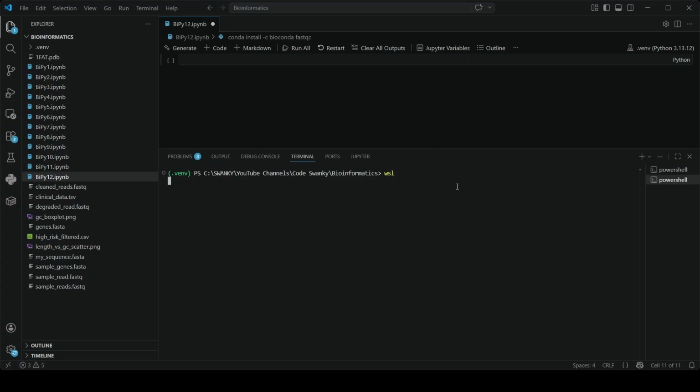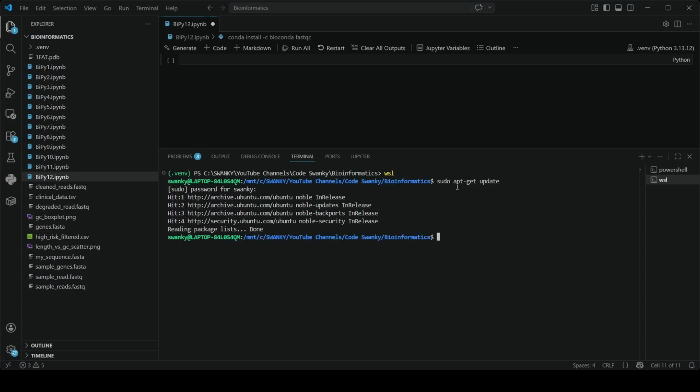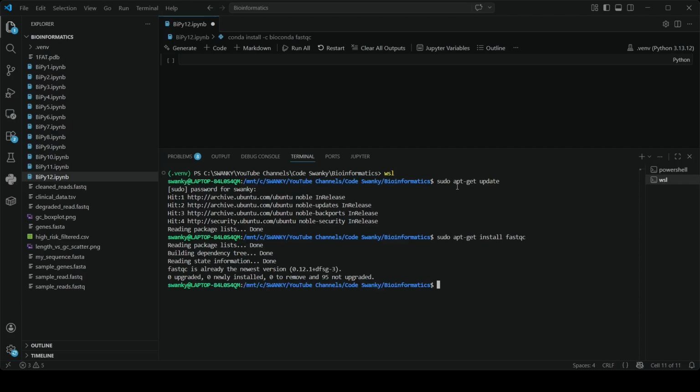So let's start WSL first of all. Then once WSL is started, you can run sudo apt-get update. It will ask you to enter your password, and once that is done, after the update, let us do sudo apt-get install fastqc. FastQC is already installed on my system, but if you run this command, it will install FastQC for you. But as you can see, FastQC already exists over here, so basically nothing happened.